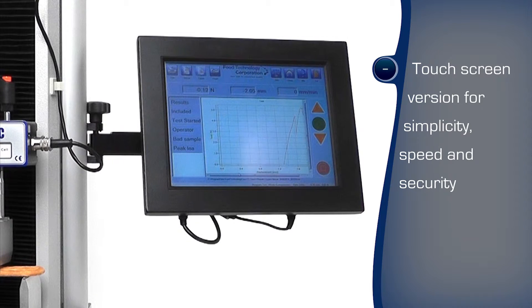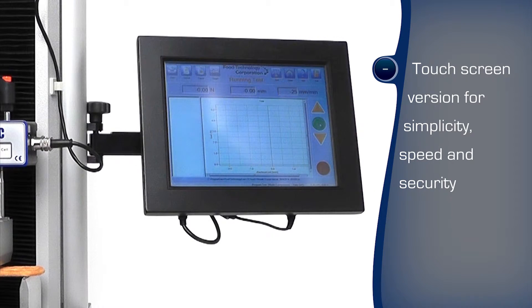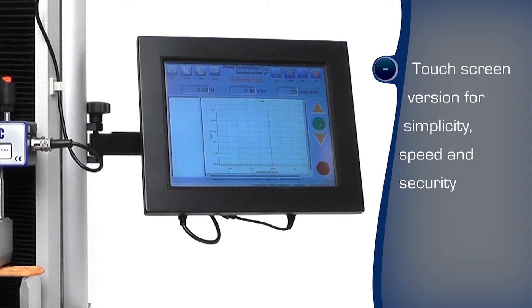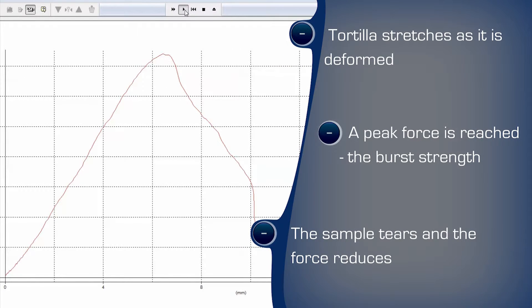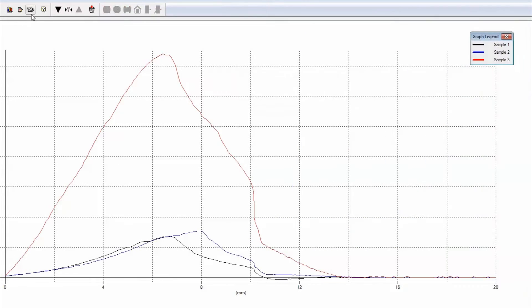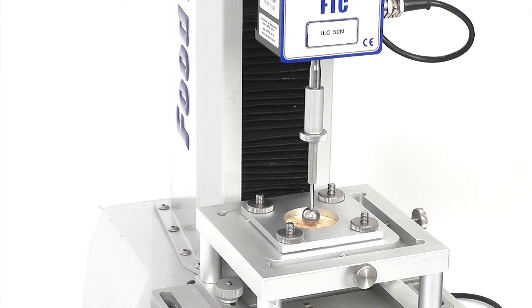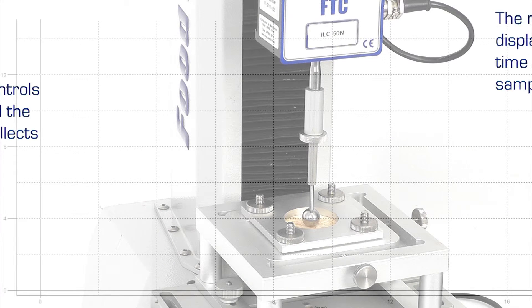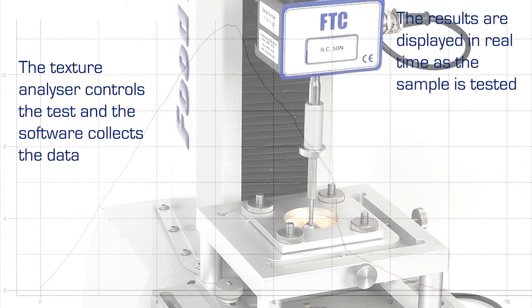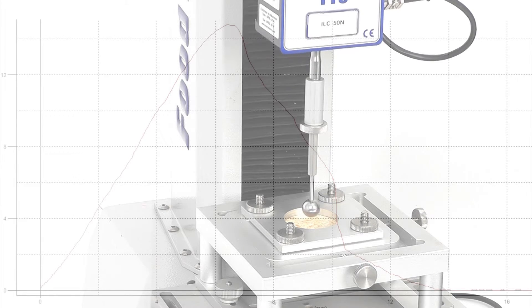The touchscreen-controlled texture analyzer runs tests at the push of a button with minimal training, which is ideal for production areas. Real-time graphing clearly shows the behavior of the sample under test. With a product requiring a combination of attributes — especially conflicting characteristics such as softness and strength — the versatility of the programming environment enables unique, proprietary calculations to be performed to create the optimal product.